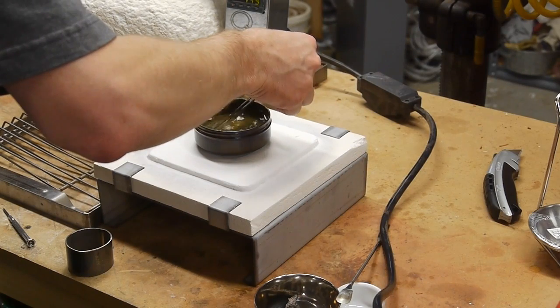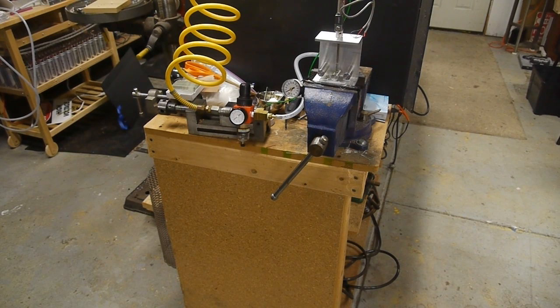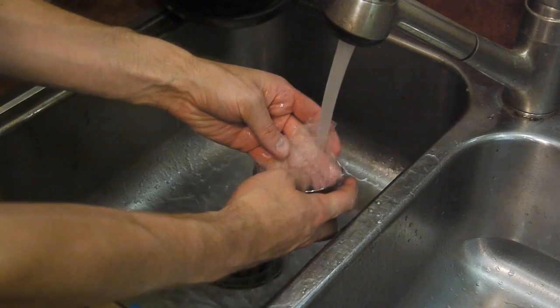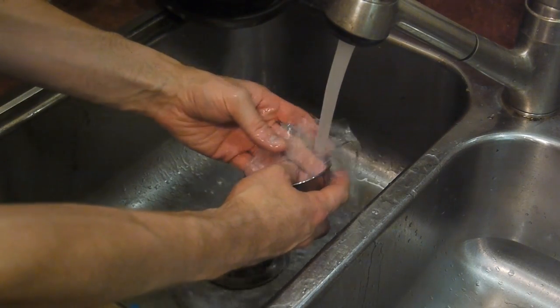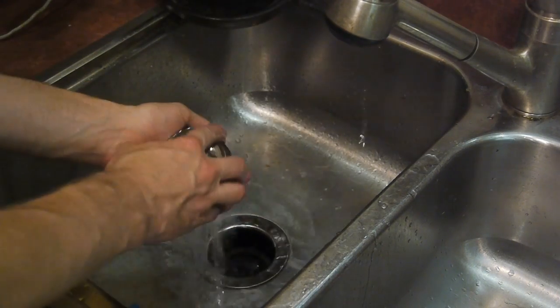After three hours at that temperature I fished the slides out and let them cool as slowly as possible but I didn't do anything special like put them into a temperature controlled chamber. I just put them out in air. After they cooled down naturally I washed the slides off in tap water and then loaded them into the test rig and tested their strength.